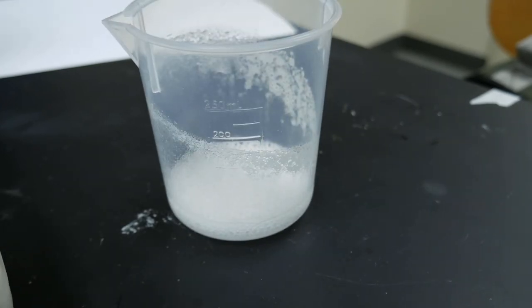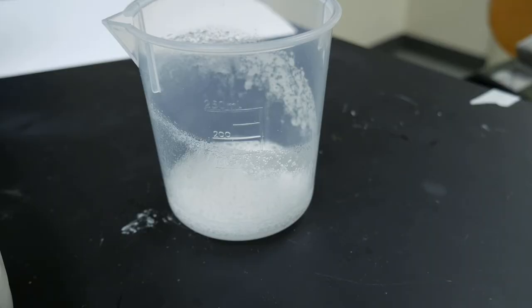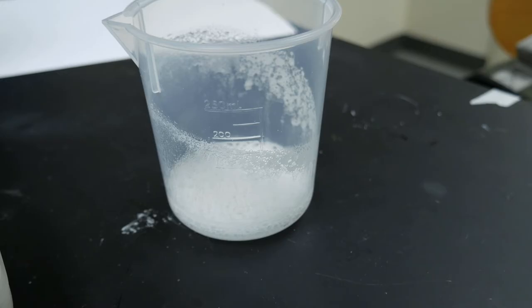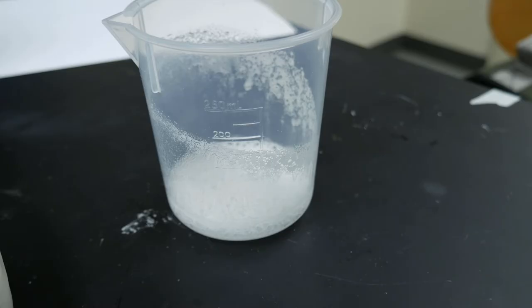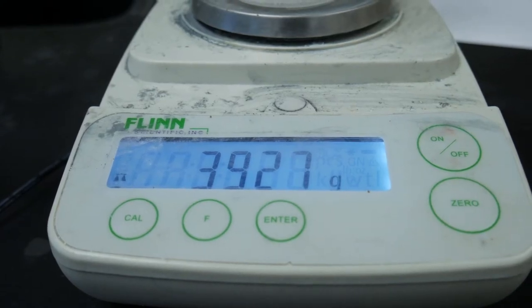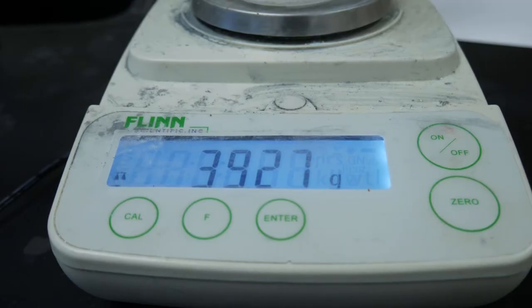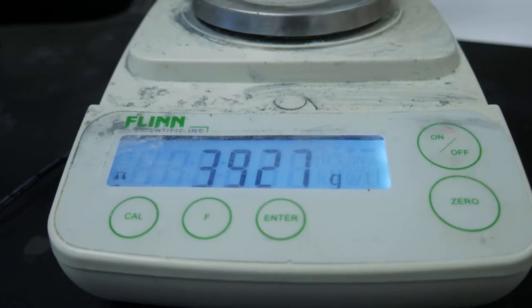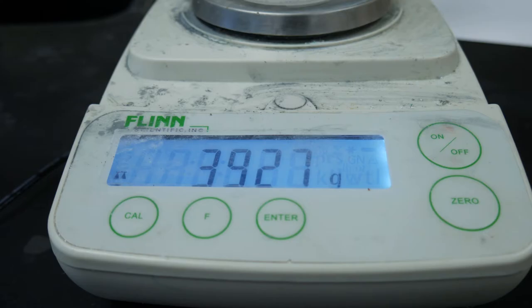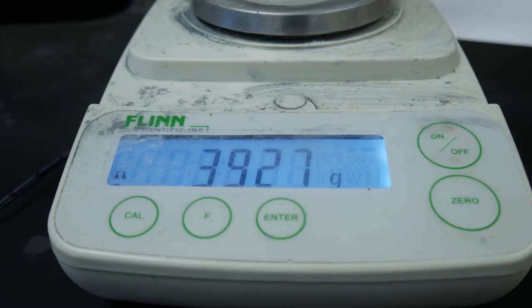It looks like the fizzing has stopped, so at this point we're going to put the beaker on the scale and record the total mass of all the products. The total mass of all our products is about 39.27 grams. Record that on your data table as the final mass of our products.